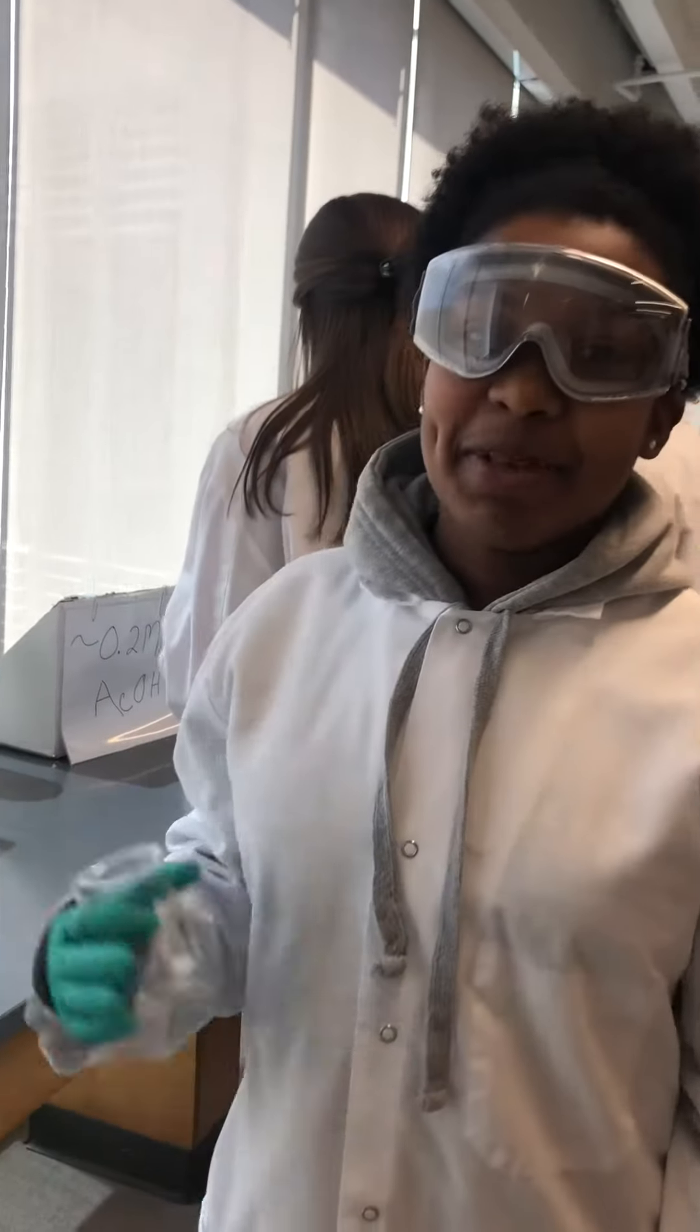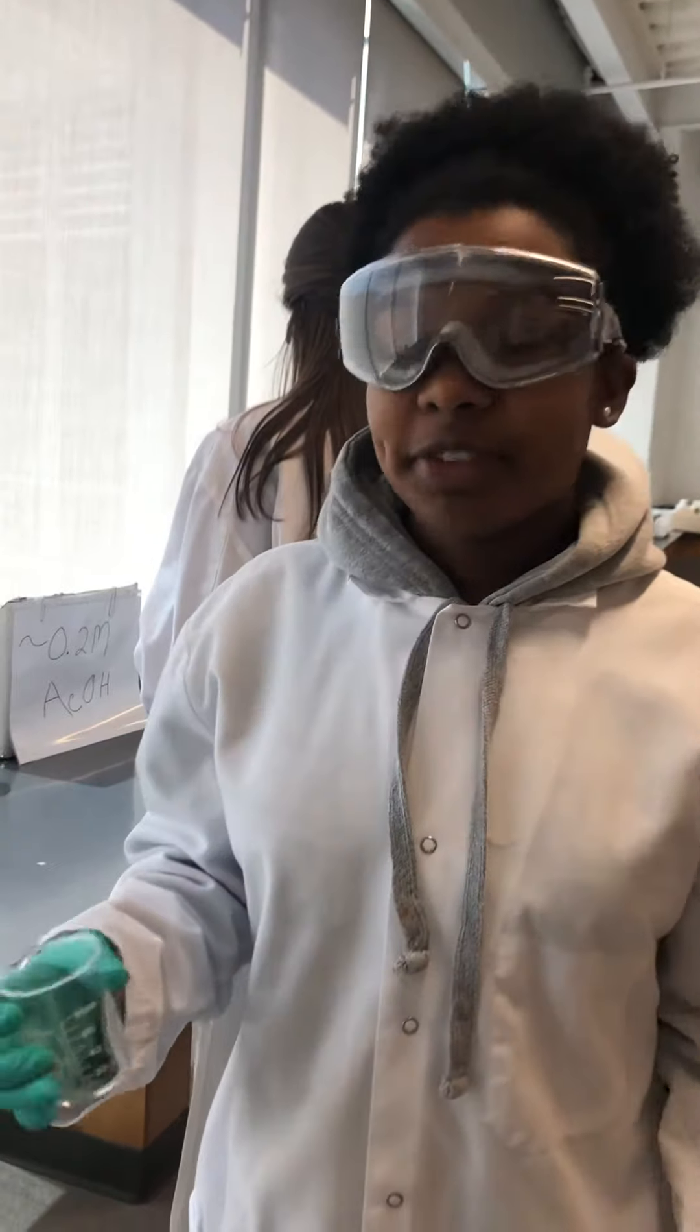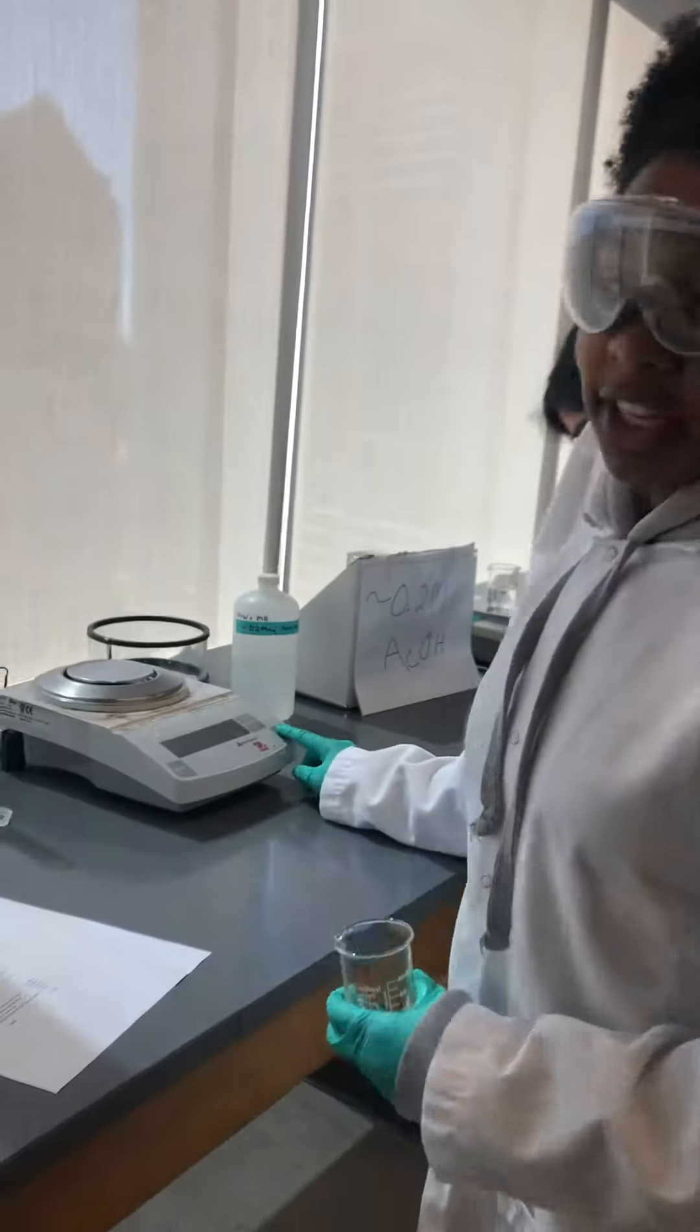This will be a video of how to measure the mass of 50 milliliters of water. So first we're going to start off with taring this.